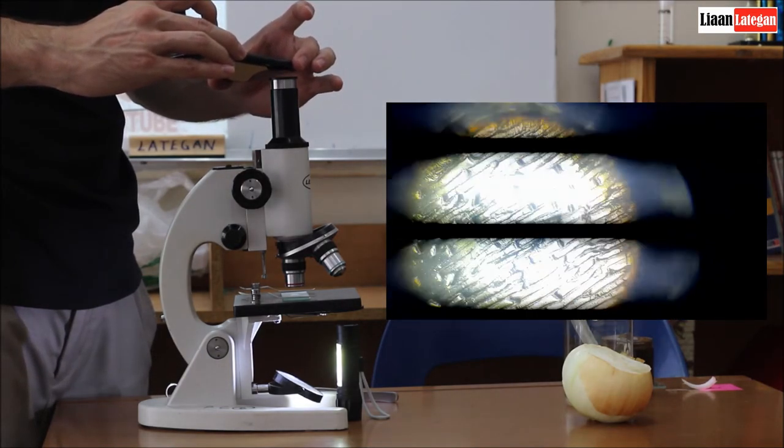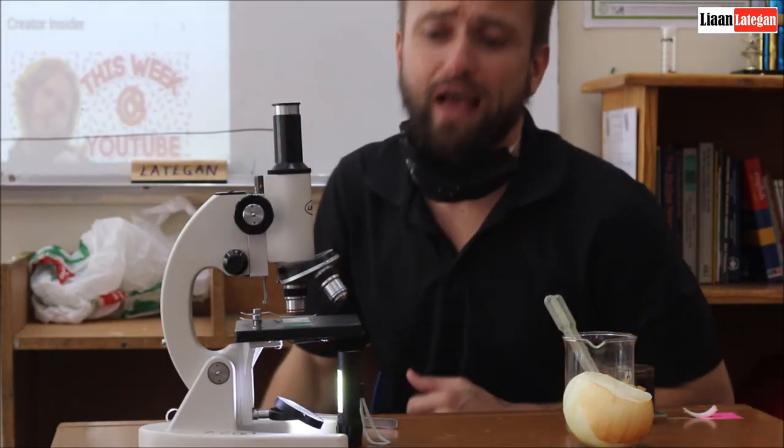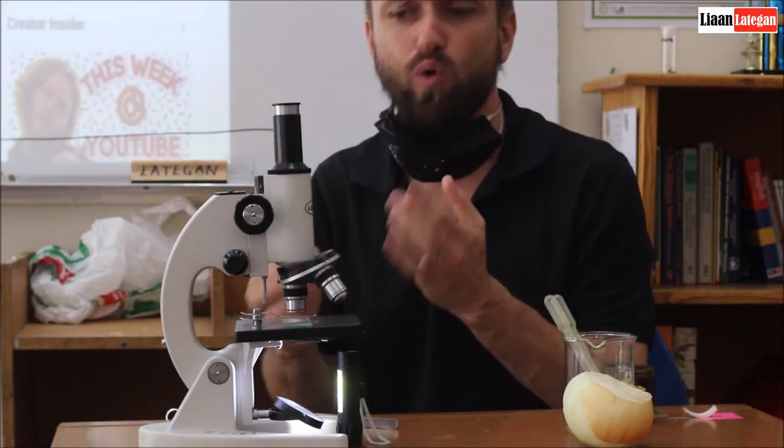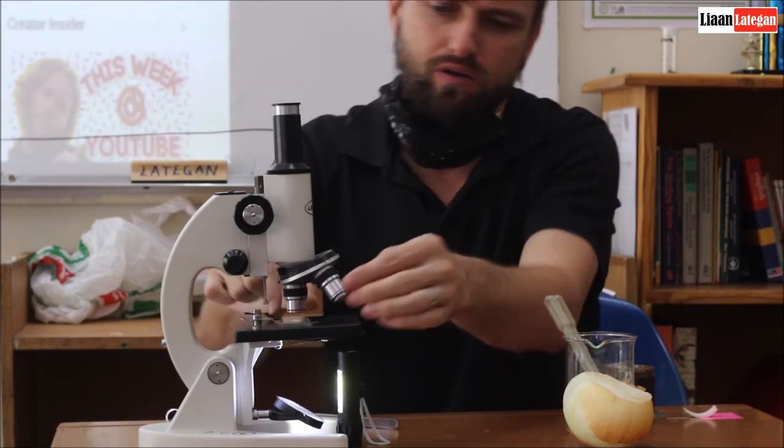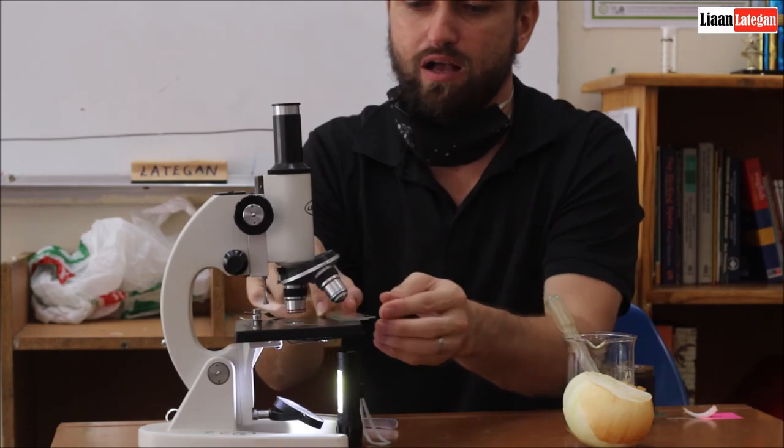Until you have a nice picture. Alright guys, so now that you've had a nice look at what the onion epidermis looks like underneath the microscope.